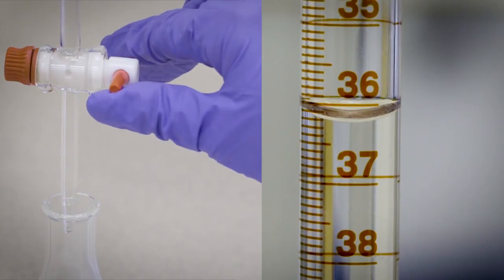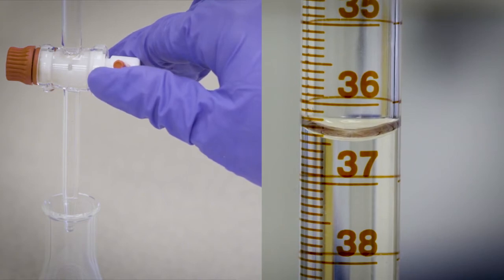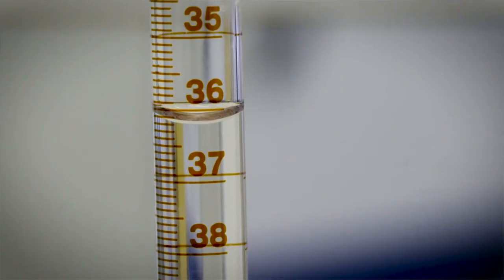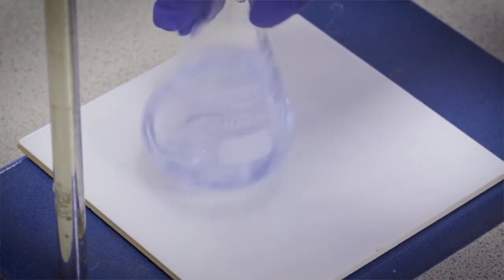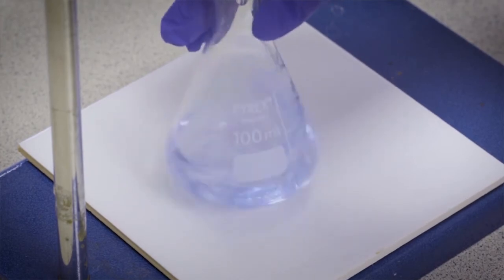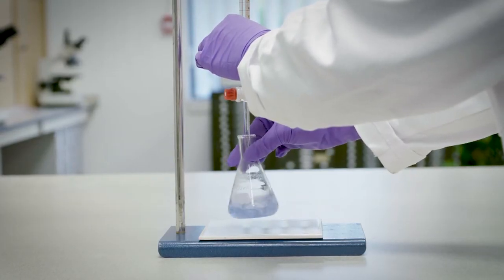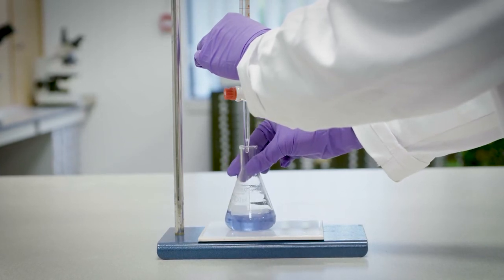The sodium hydroxide is now added slowly, and the flask is gently swirled. The slow addition of drops is repeated until a permanent colour change is observed. The permanent blue colour is very pale. A second accurate titration should be measured, and at this point, the burette may need to be refilled to the top with sodium hydroxide.